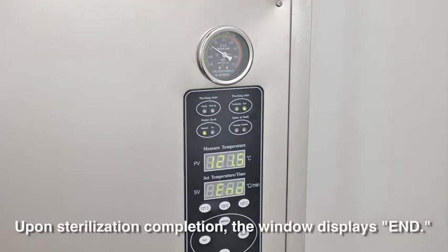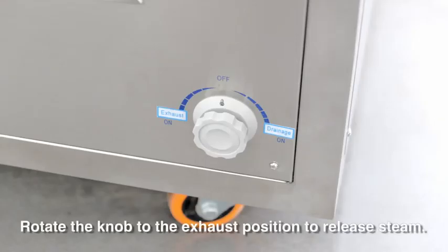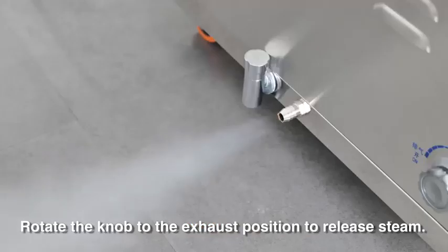Upon sterilization completion, the window displays 'end'. Rotate the knob to the exhaust position to release steam.